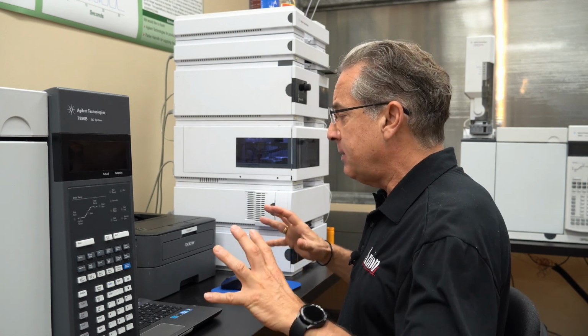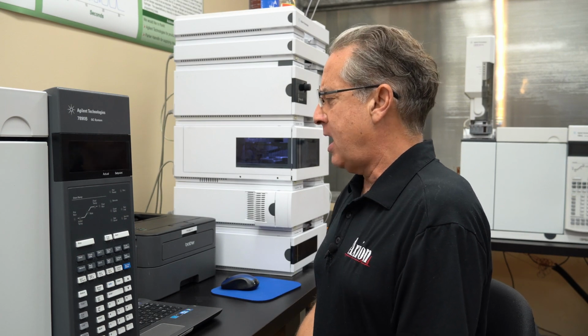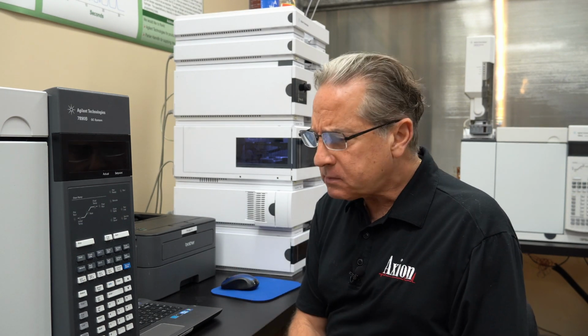Let me start with the first question that came in, and that is, what happens if my pump runs dry? What happens if my pump pumps air through my system? And the answer is, let's try not to let that happen. The way we do that is we can set a minimum pressure limit on the pump.